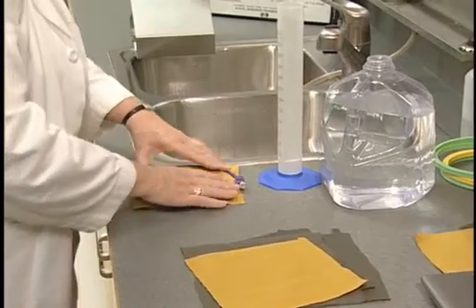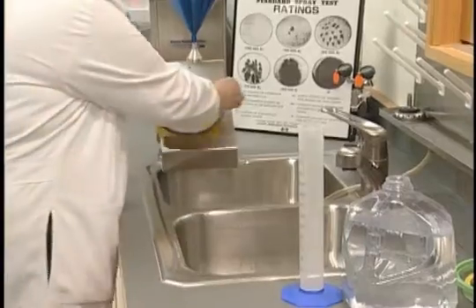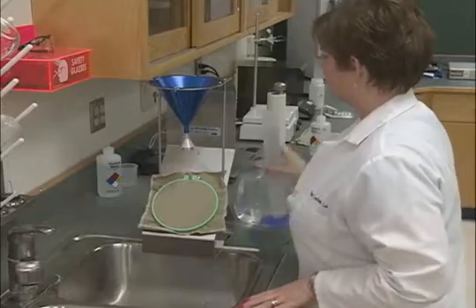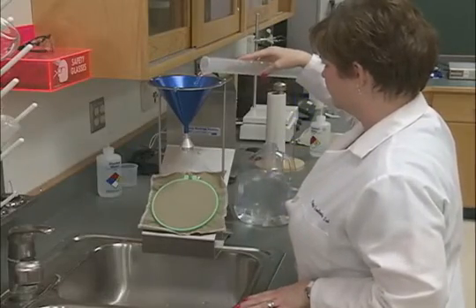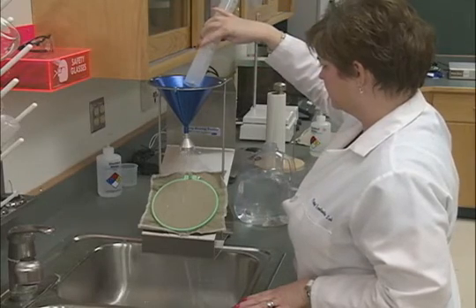The embroidery hoop with a mounted specimen is placed on the test assembly stand configured at a 45 degree angle. The bottom of the spray nozzle is positioned so that the water will fall on the center of the mounted specimen from a height of 15 centimeters.